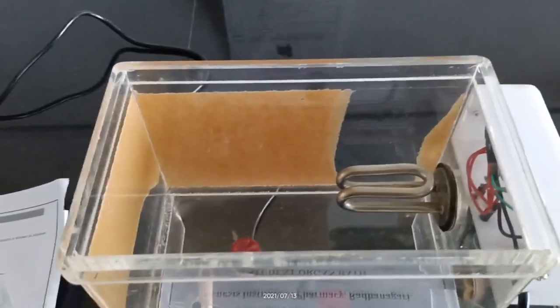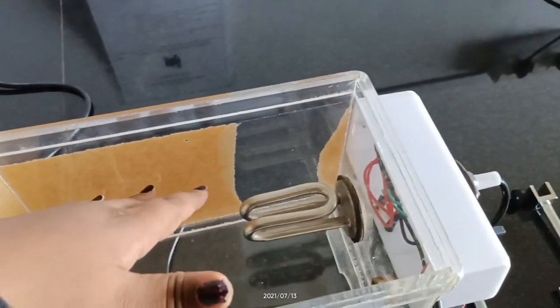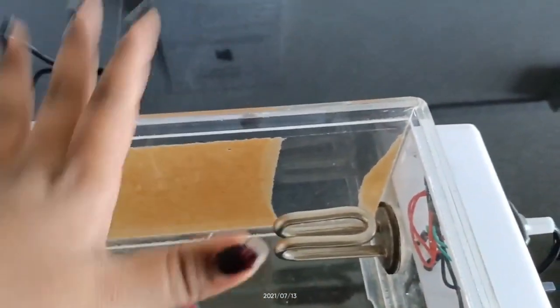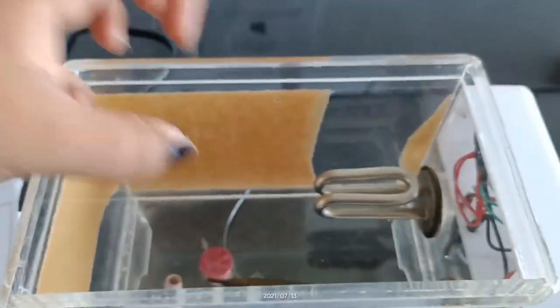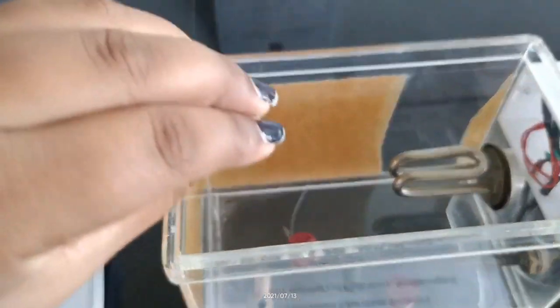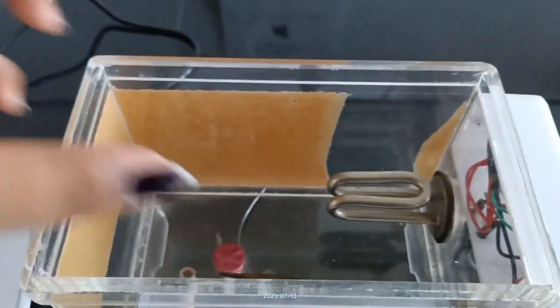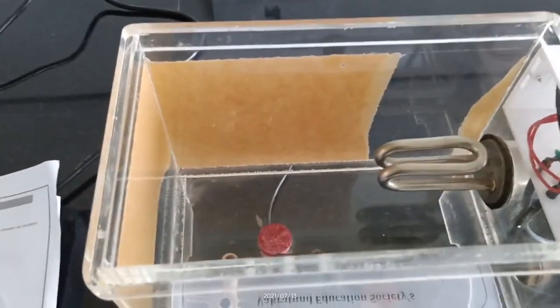Why do we use the stirrer? The heater heats the water, but the temperature is not evenly distributed throughout the entire water bath. So to distribute the temperature equally throughout all of the water bath, we use the stirrer.